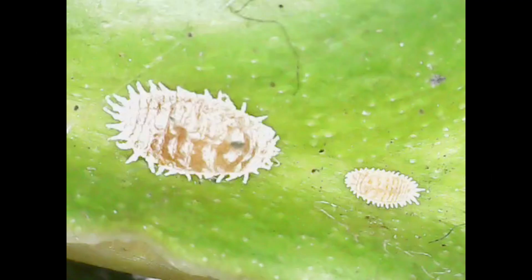Let's have a look. So here you can see that cottony structure. You can see one baby mealybug there that hasn't got its fluff just yet, but can you see all those other little legs and little things that are moving within that cottony structure? That is more baby mealybugs. Joy. But this is why some of these things can spread quite quickly. So you can see all those other baby mealybugs there. All the things that are brown under there are other potential mealybugs that are ready to emerge. This looked like one mealybug without the microscope, basically.